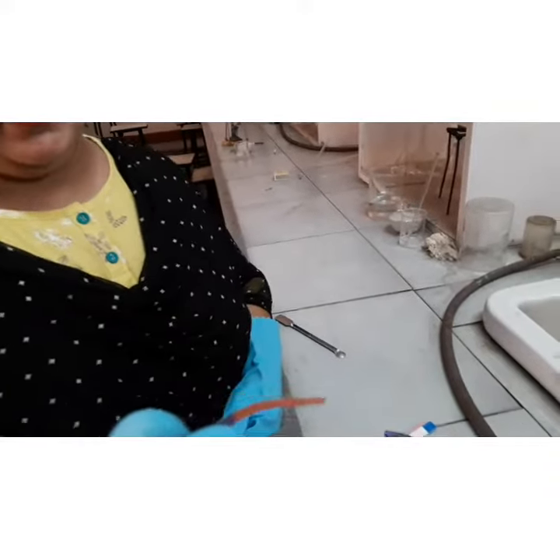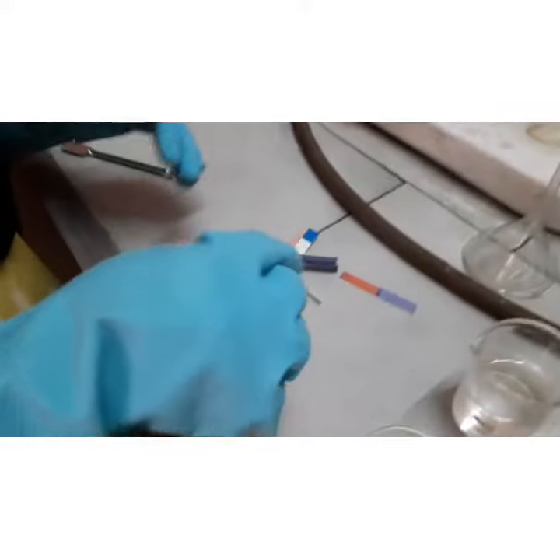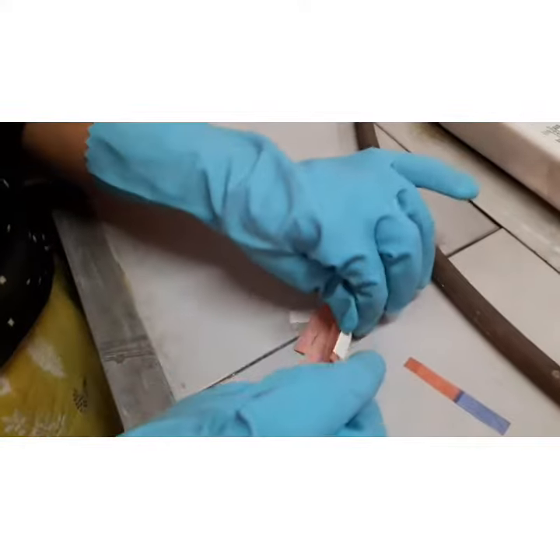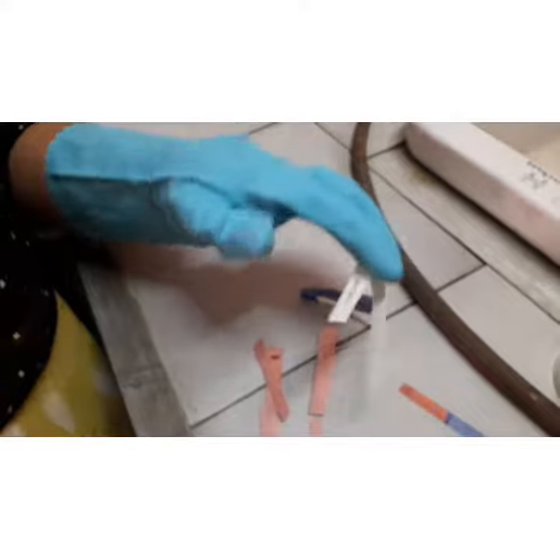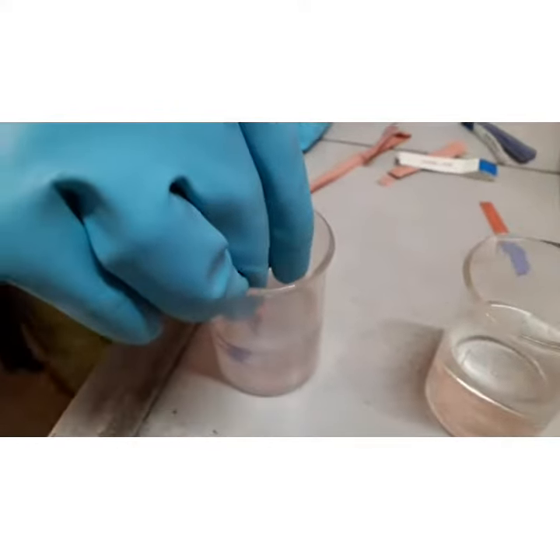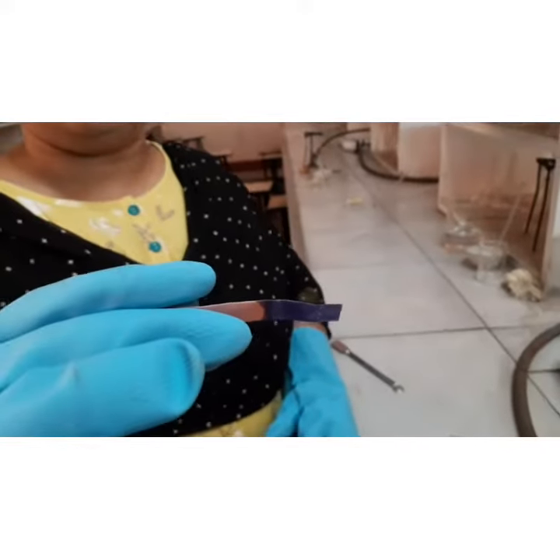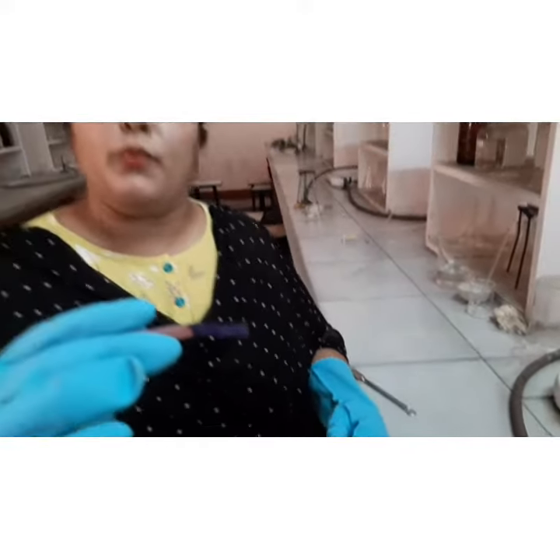Red color shows acid. Now for base, we will use a red litmus paper, and it will turn blue. This means that the solution contains a base.